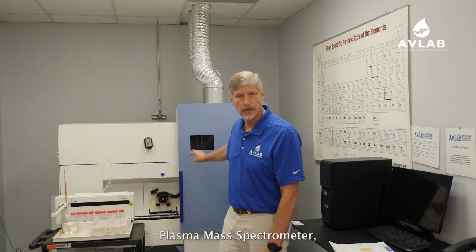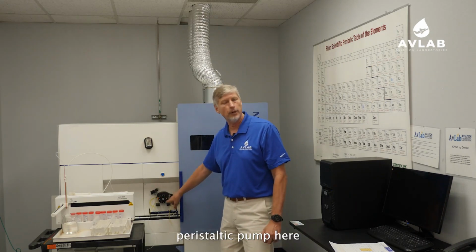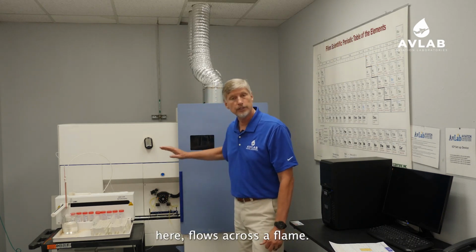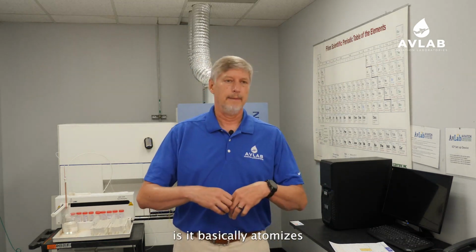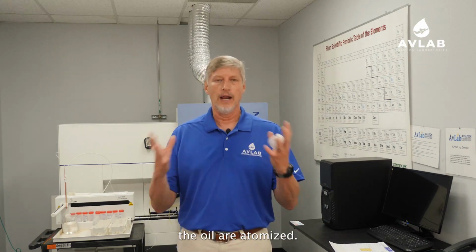So the diluted sample now is put on an auto sampler in our ICP, our inductively coupled plasma mass spectrometer, and the instrument draws that sample into it through this peristaltic pump here on the front of the instrument. It draws into here, flows up here, flows across a flame. What the flame does is it basically atomizes all of this oil. So all of the wear metals that are in the oil are atomized.